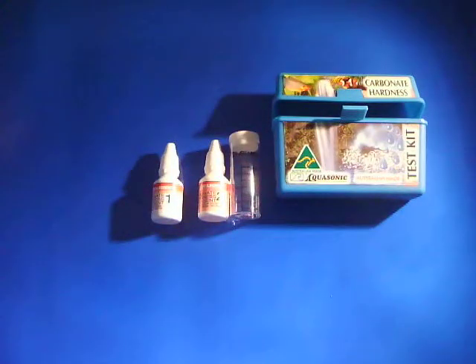One of the reasons why you would do a carbonate hardness test is to check your water. Your water will have a relationship with the carbonate hardness to how well and how stable it is, specifically in regards to pH. So if you find that when you do the measurement you are only getting like one drop to get to the end point, you are going to have a very low carbonate hardness.